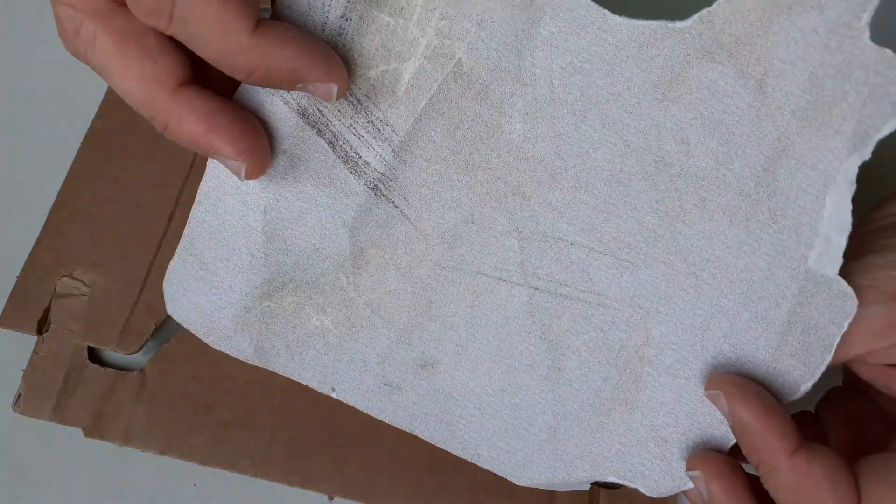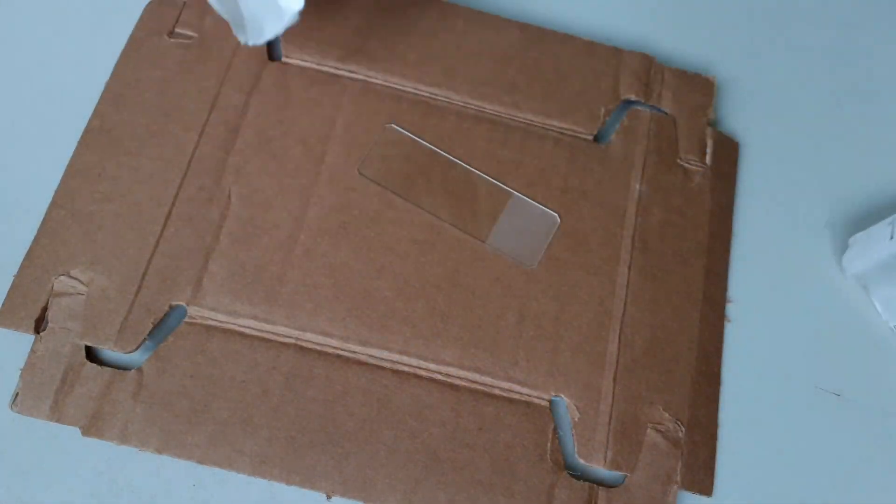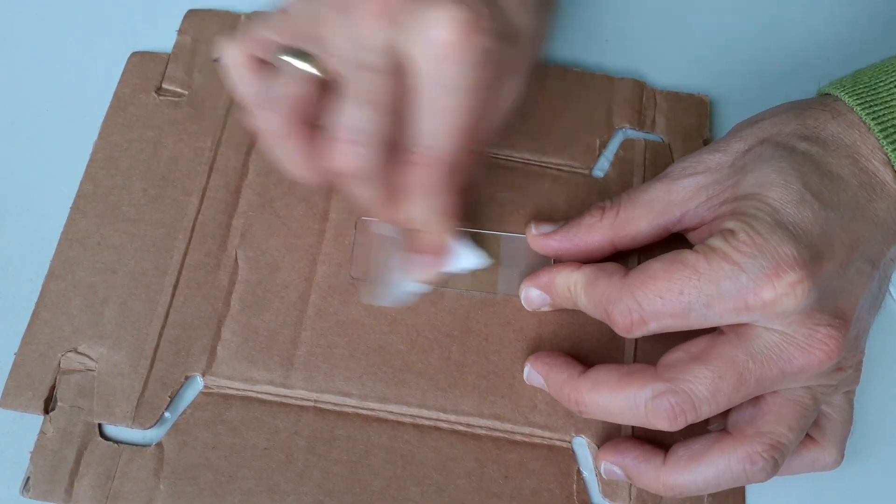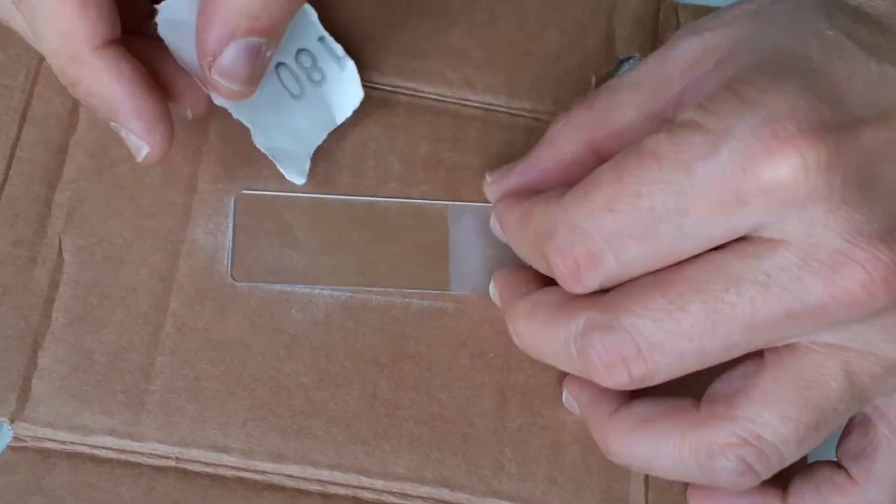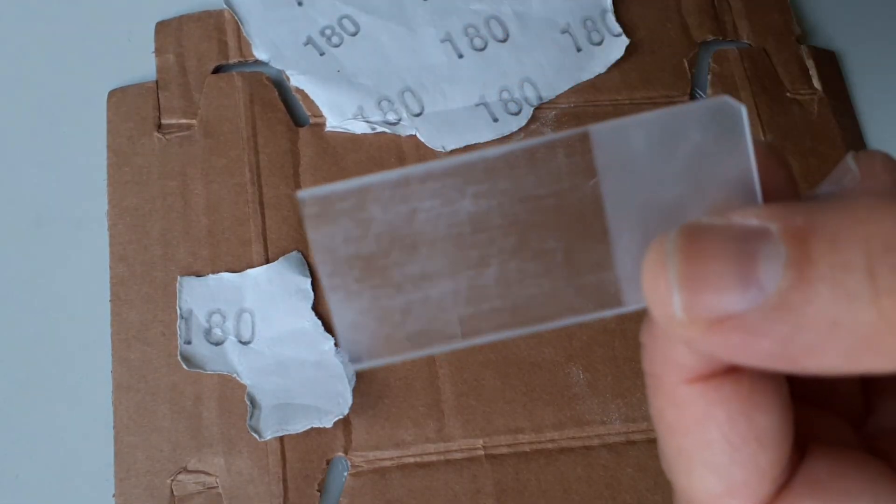Yeah, so this is sandpaper and one of the two slides that I'm testing I'm going to scratch the surface with the sandpaper to make sure that the nail polish sticks better. It's actually only a test to see if it's actually worth scratching the surface.